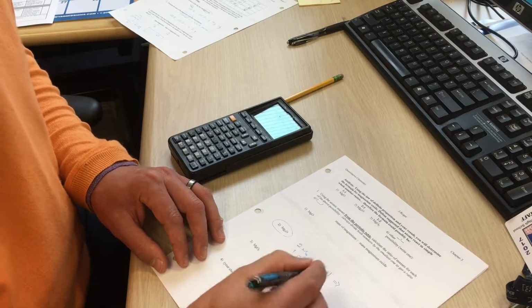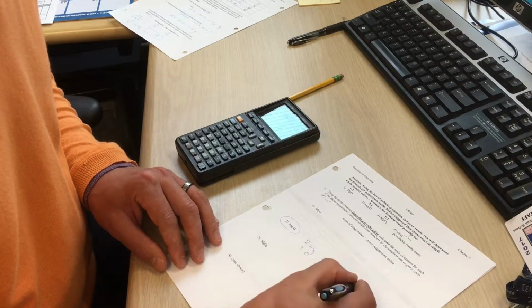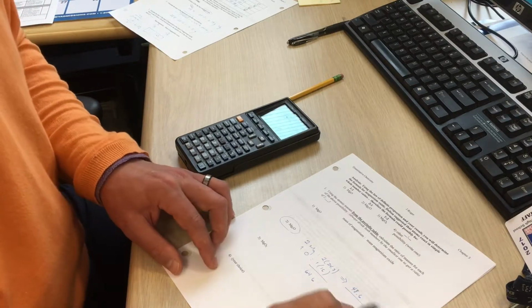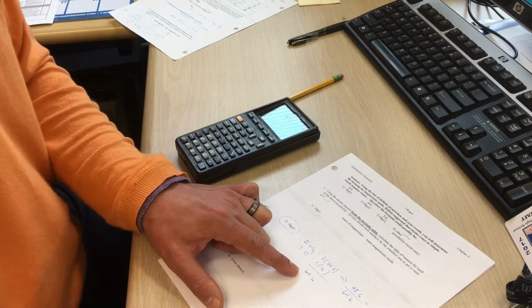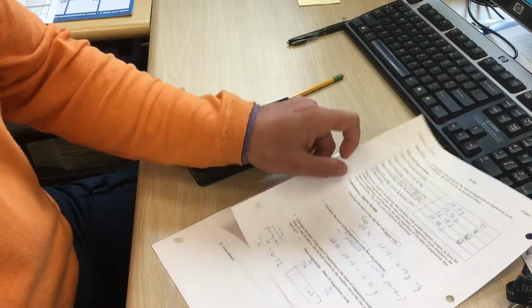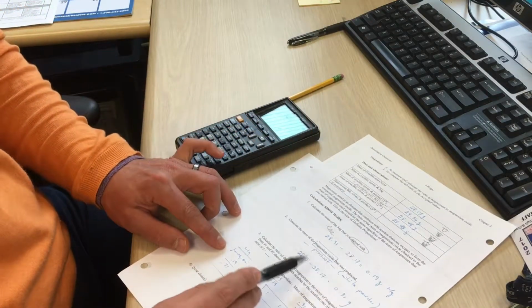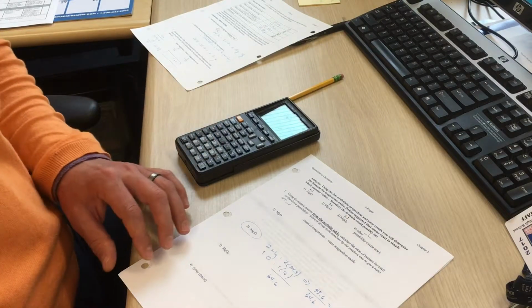And so the magnesium is 48.6 of a grand total of 64.6. So the mass of the magnesium divided by the mass of the magnesium oxide, which is exactly what we did from our results. If the percentages match, then it's the same compound. The law of definite proportion.